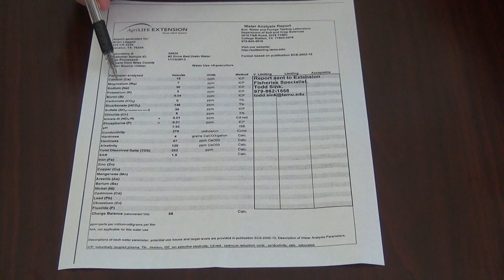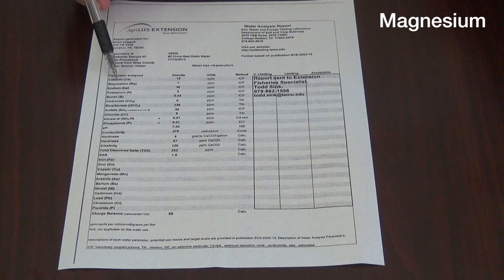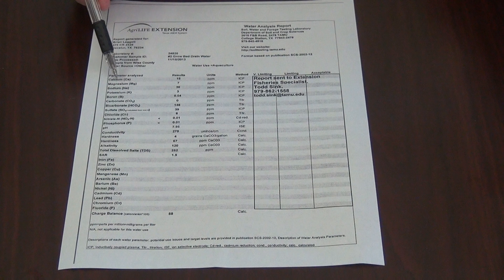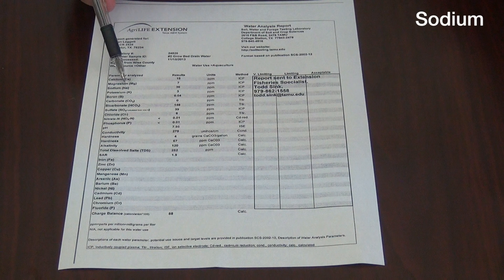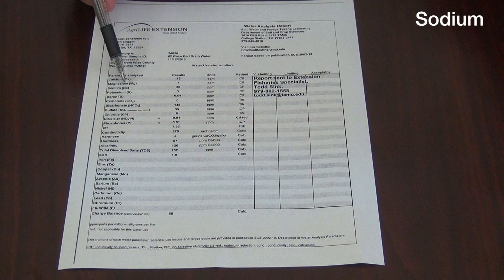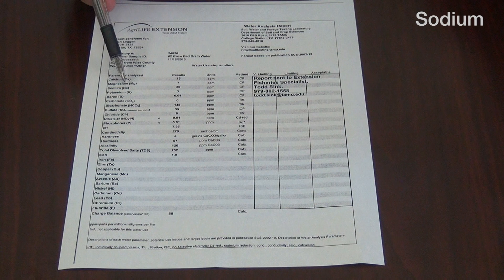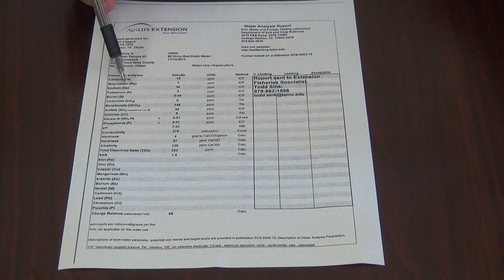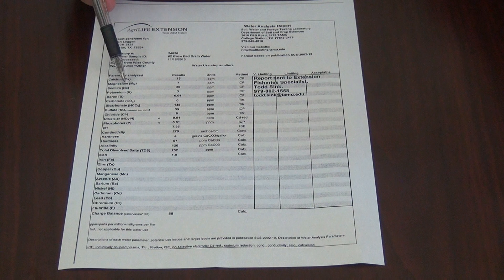Here we see the magnesium concentrations in the water. Magnesium is generally not limited in fresh water, although it may require supplements in some brackish or marine pond environments. Next on the list, we see sodium. Sodium is a major salt constituent of water. In general, we like to see a relatively low sodium concentration. You generally do not need to concern yourself in a freshwater environment unless the sodium concentration exceeds 3,000 parts per million. In many areas in Texas, we have high salt contents in the soil as well as in the water, so your sodium content may be higher than 1,000 parts per million.